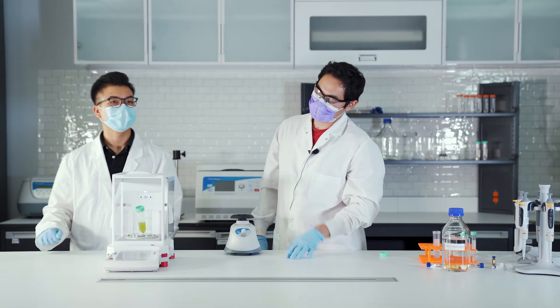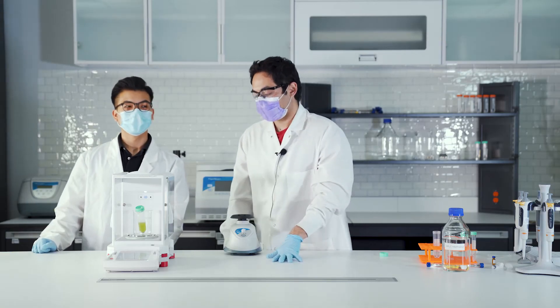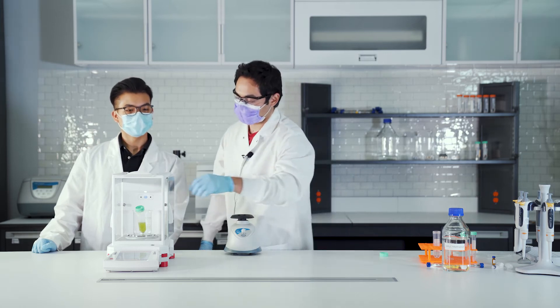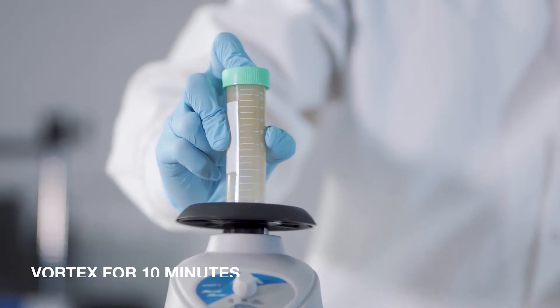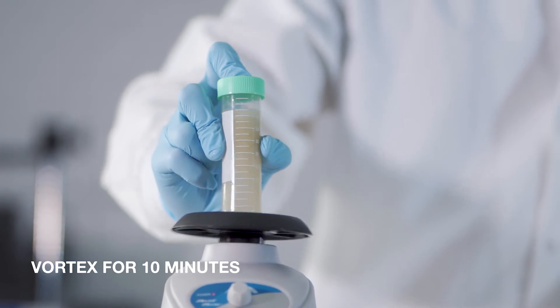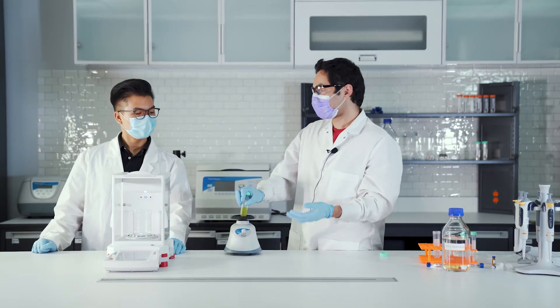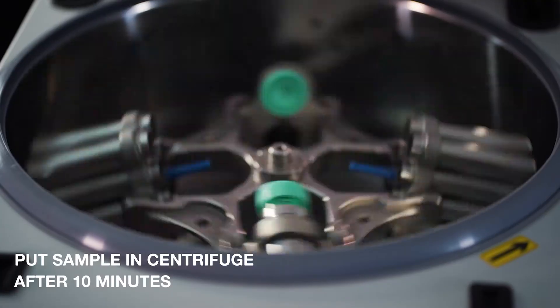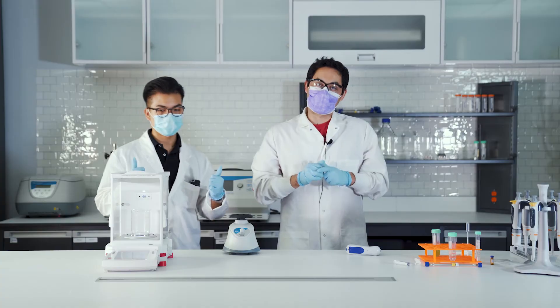Make sure that's about 20 mils. You also have to make sure you factor in the density of methanol, 0.79 grams per mil. Let's vortex. You want to do this for roughly 10 minutes. After you vortex for 10 minutes, let's go ahead and dunk this in the centrifuge.